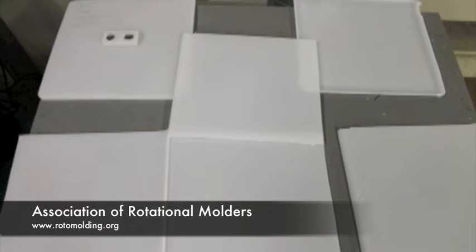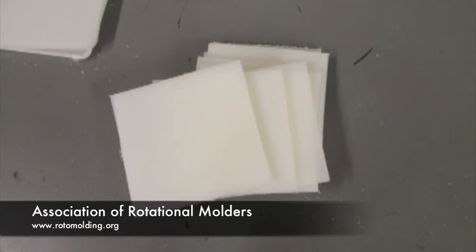The 12 by 12 sides are cut into 5 by 5 squares labeled 1 through 16, with the part thickness measured on the mold contact side.